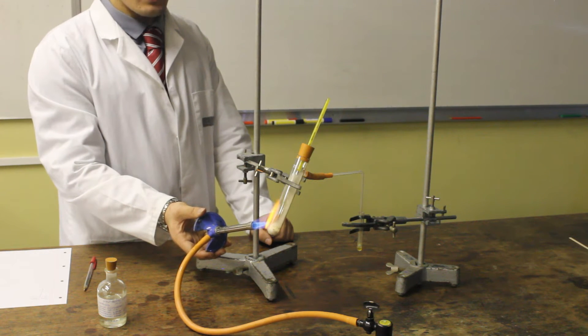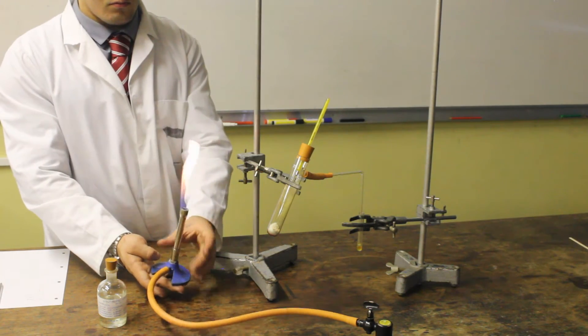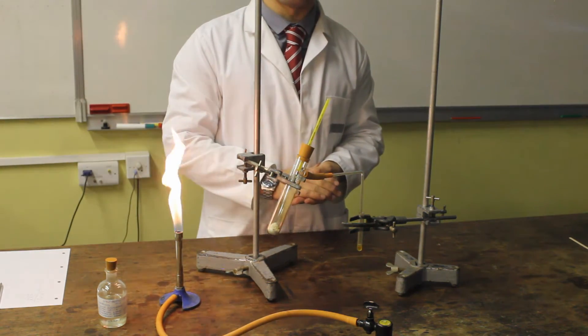We are now evaporating our third and final fraction. We have now collected our third fraction and now it's time to test them.